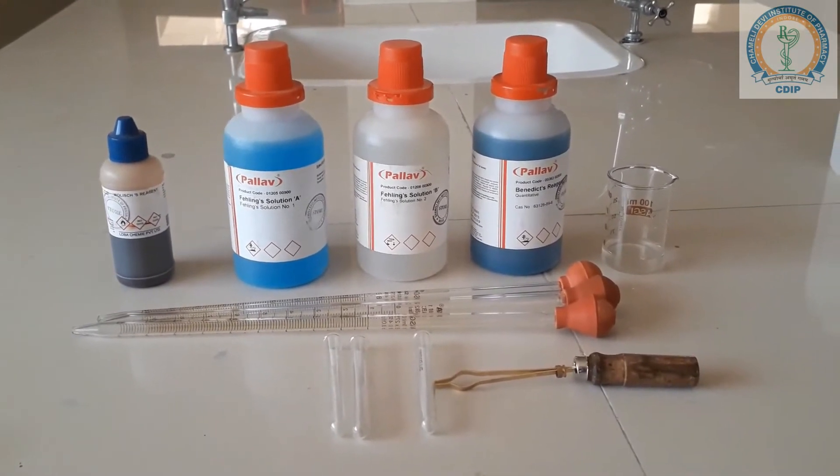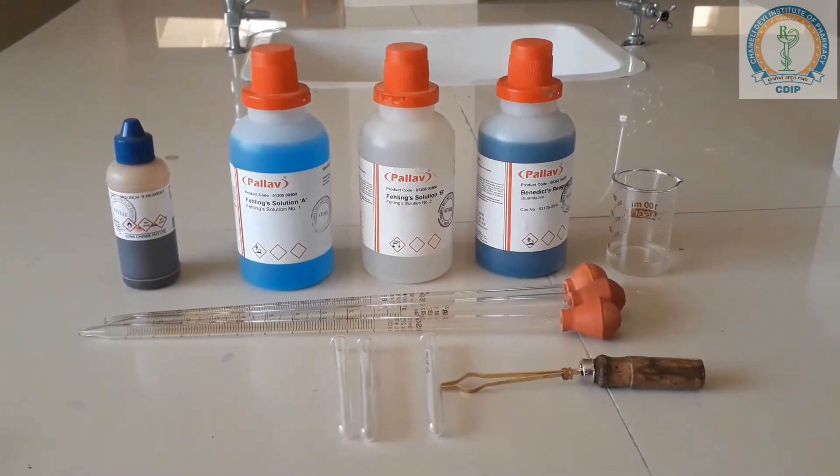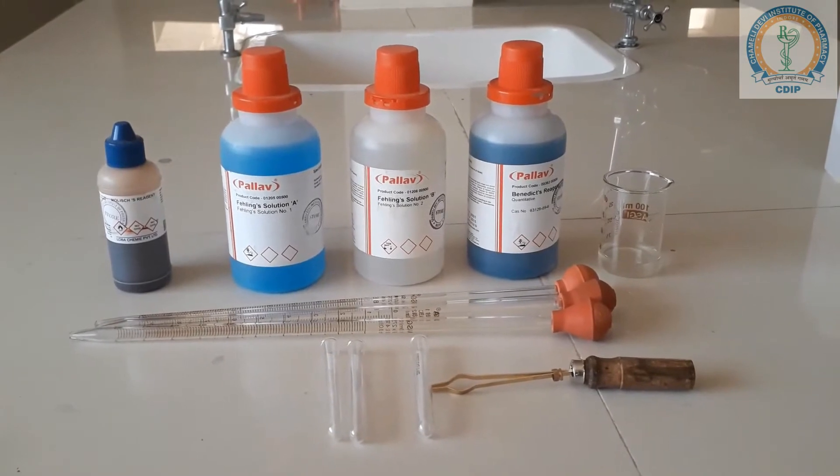In today's video, we will perform the qualitative analysis of carbohydrates.